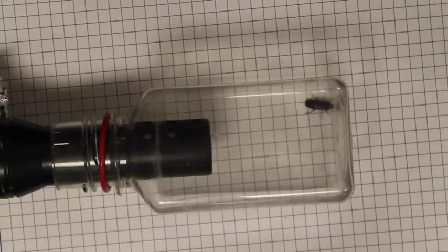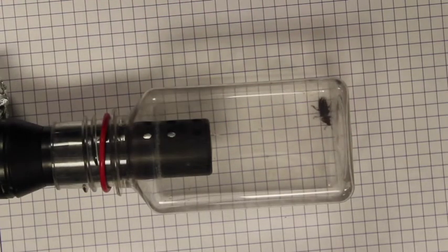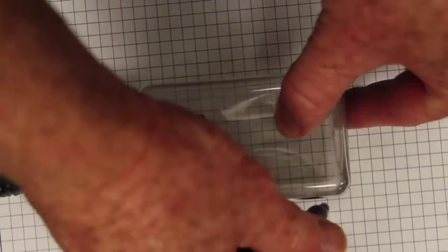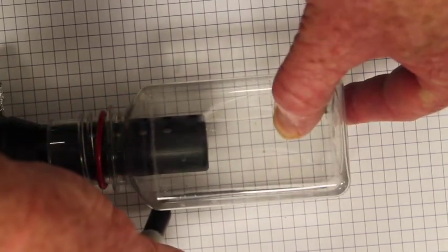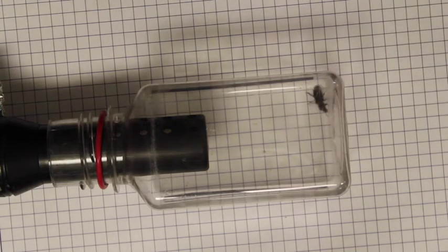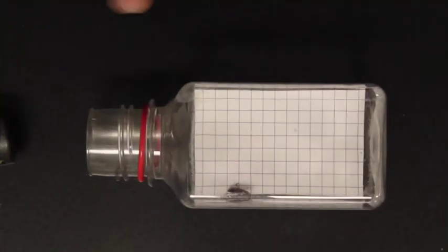So in looking at this setup, I do notice one thing. If you watch the poor beetle move around, its legs are slipping. Since its legs are slipping, we're not going to get a true measurement of the distance it moves, so it needs a little bit harder surface than the plastic. So I'm actually going to cut out a piece of paper and then secure the paper inside the chamber so that the beetle has to walk on that paper. So I'm basically going to take that, cut it out, and insert it inside. So here we go, we've got it fixed. I put the piece of paper inside the jar now so the beetle's not slipping all around.